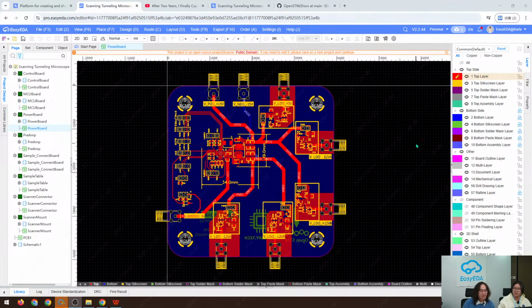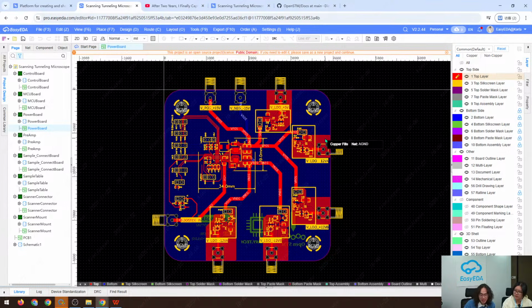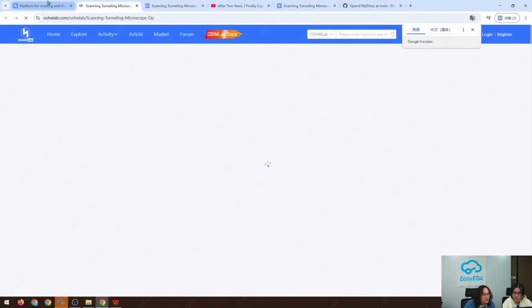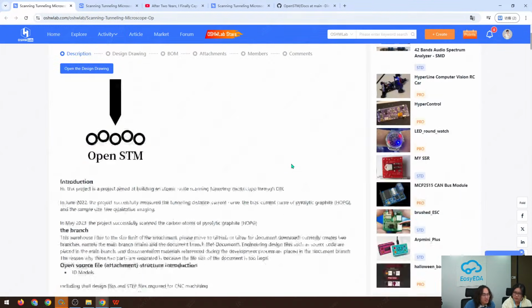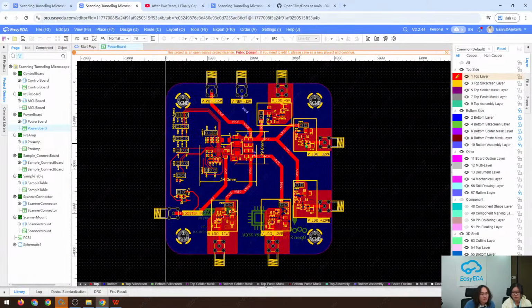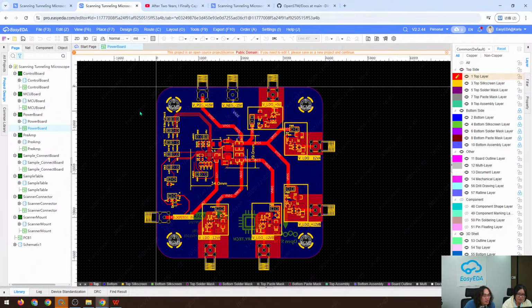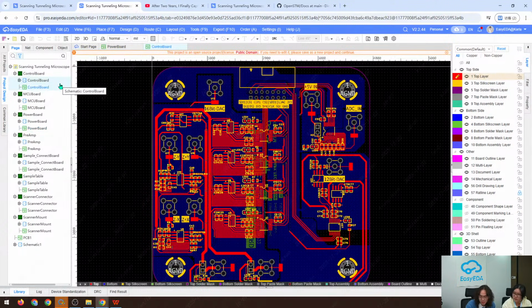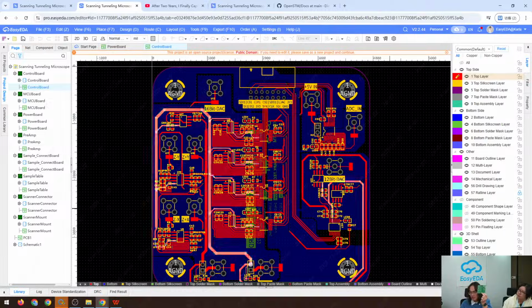Welcome back, and so this is the piece, and as I mentioned before, all these PCBs are designed using EasyEDA, and we can take a look. This is the open source page, and if you click this open design drawing, you can get into my circuit design, and basically there are a lot of PCBs here. I can introduce them briefly. For the control board, this is the control board, which is basically just this one, and I can show you in front of the camera.